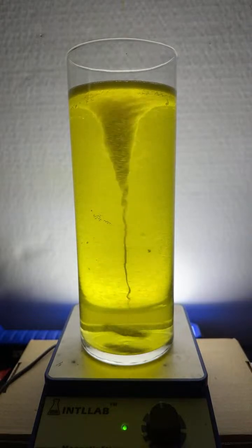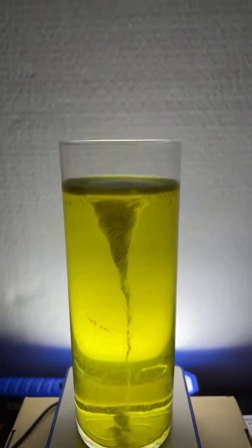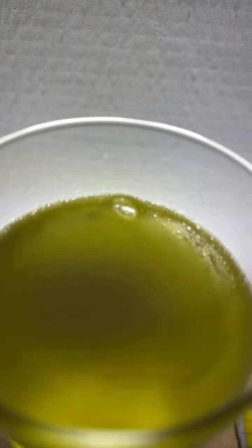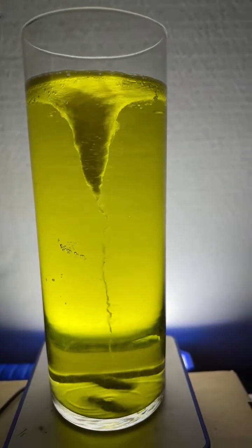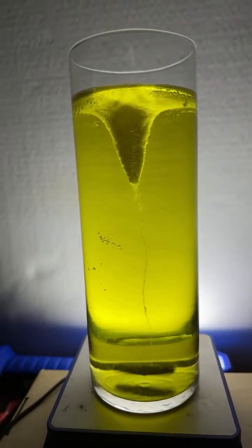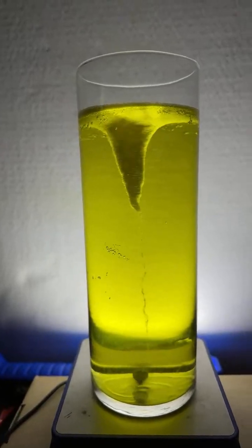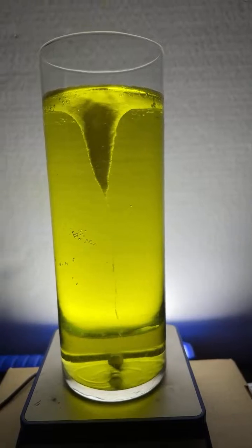I don't know if you all can. I'll get the camera closer, see if you can hear it. I don't know if you can hear that or not. I hear it foaming. Anyway, yeah, now we've seen that it's cleared up. And we also see that the bubbles are trapped in the vortex. I got off kilter somehow, and I don't know what I did.